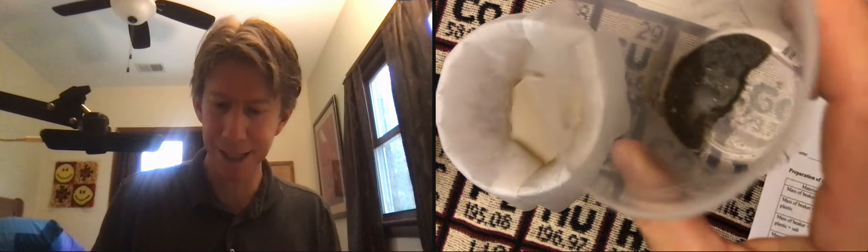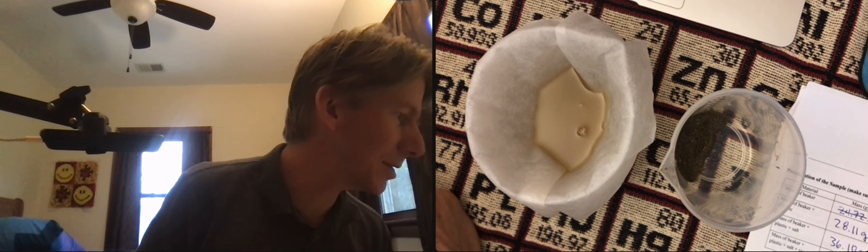And again, now there's my 50 milliliters. And here's my sand. So I'm good to go. And I'm going to let that drain until it's almost all done.